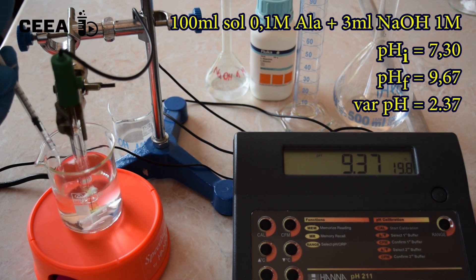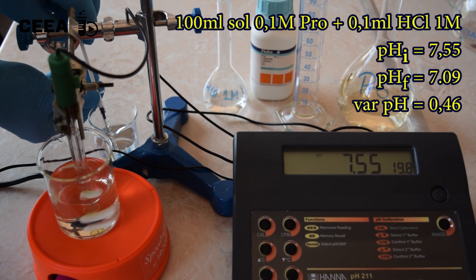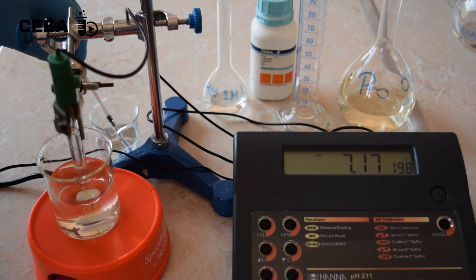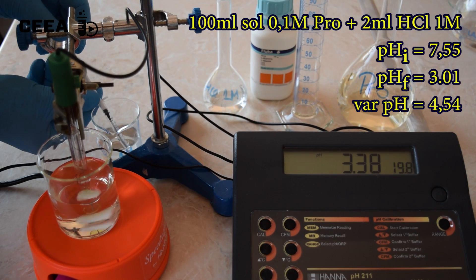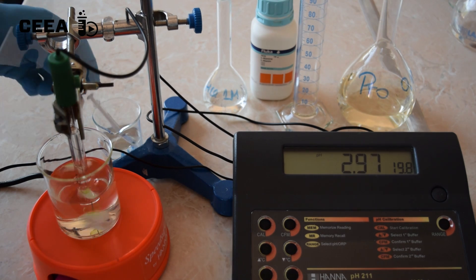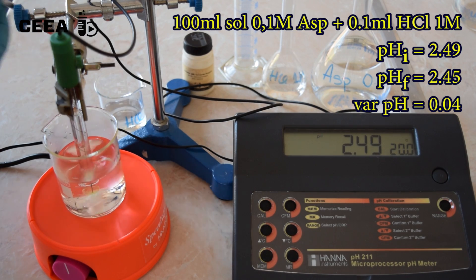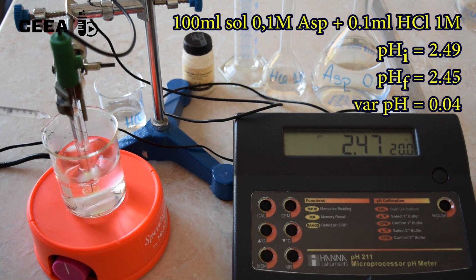Observe that proline is behaving almost the same as alanine and glycine. Aspartic acid is already acidic. Adding a strong acid to it, we notice a very slight pH drop.